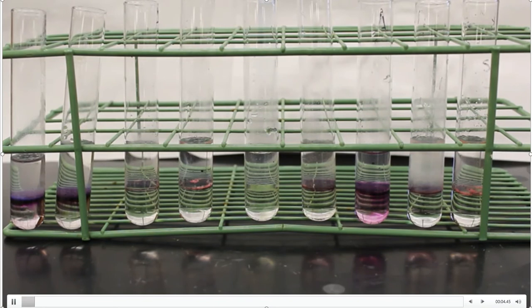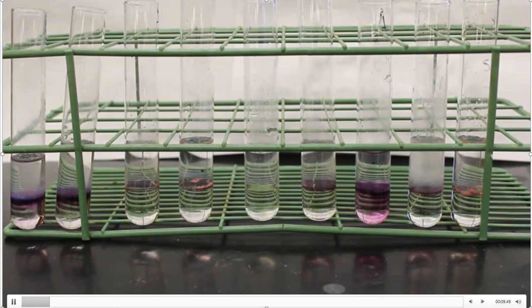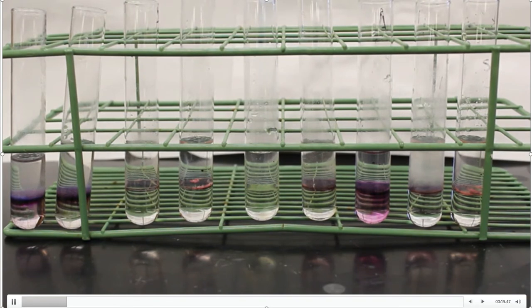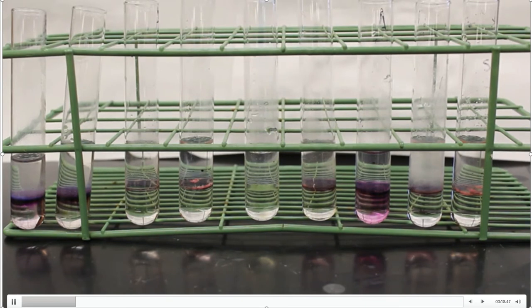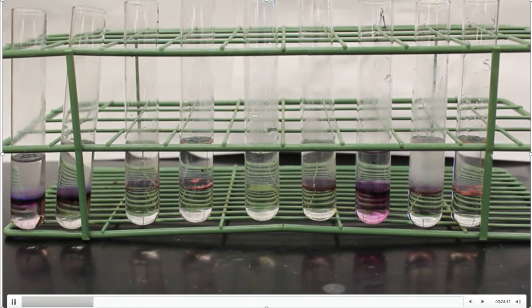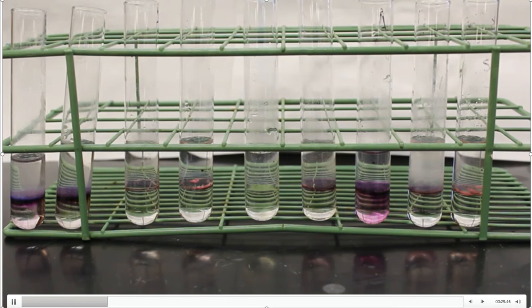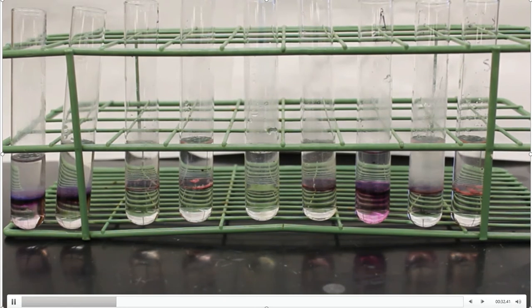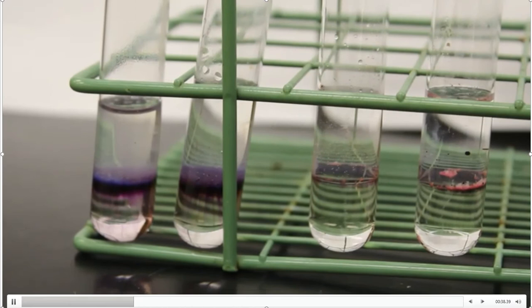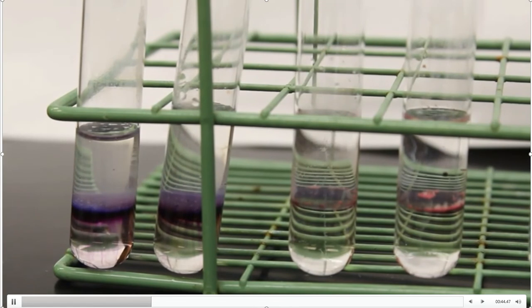So we're back with the Molisch test. This took me about five minutes to finish adding the sulfuric acid to the rest of the test tubes. Here's the overall view of what we're seeing with the Molisch test. Some of these we know are carbohydrates; some we might not know, especially unknowns A and B. That's the whole purpose of analyzing those. I want to now turn to each one of these test tubes so that you can really record your observations.